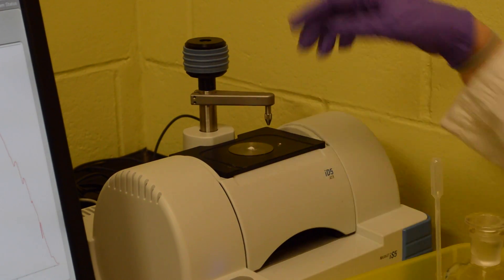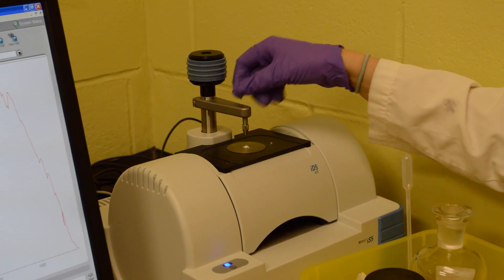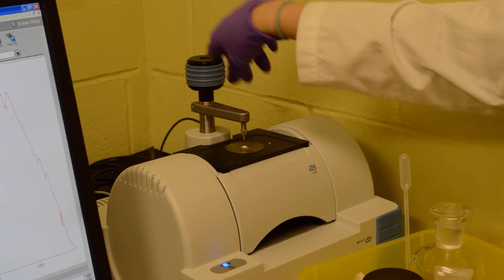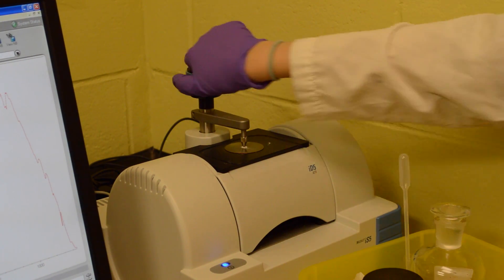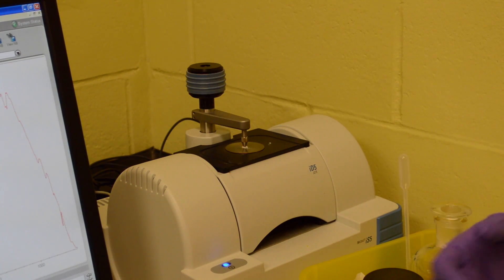Now we're going to crush our sample solid on the crystal by turning this to the left, and then turning this to the right until you feel the click. You might have heard the click but I felt the click. Then we're ready to collect the sample.